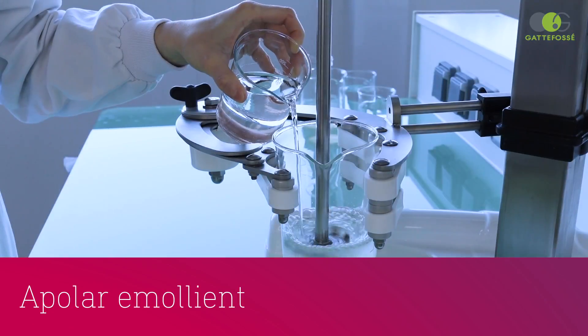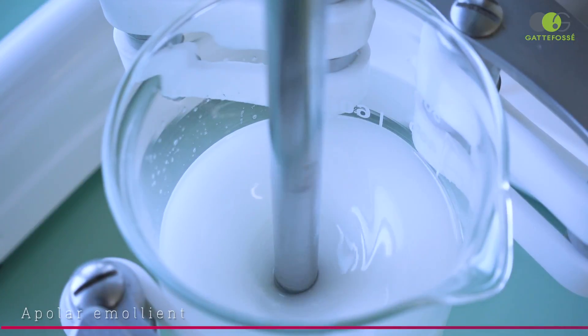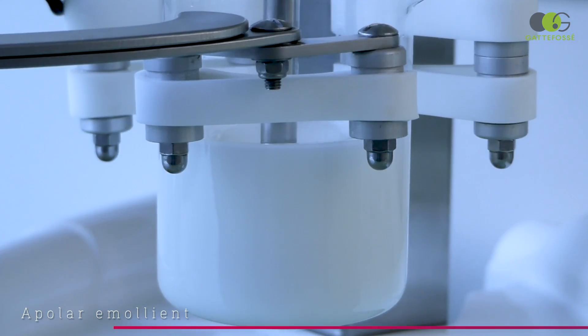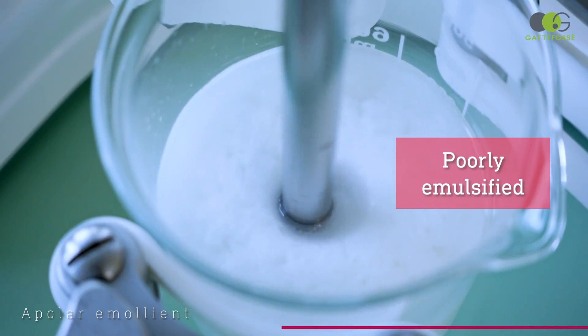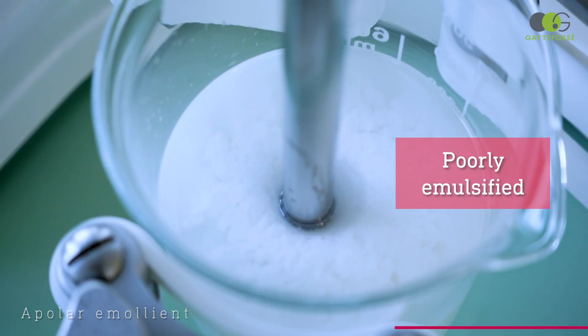We are now making our apolar trial. We observe, once again, a disturbed emulsification process similar to that of the silicon oil test.